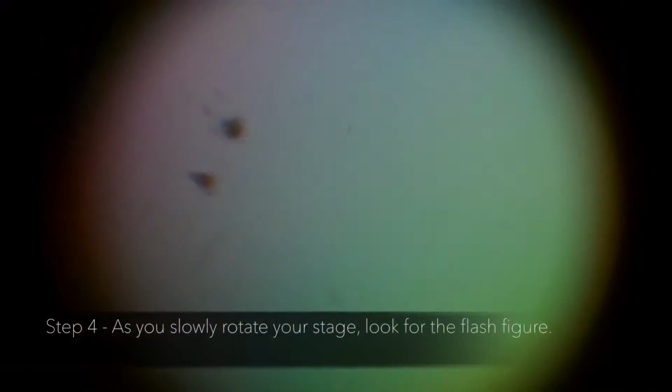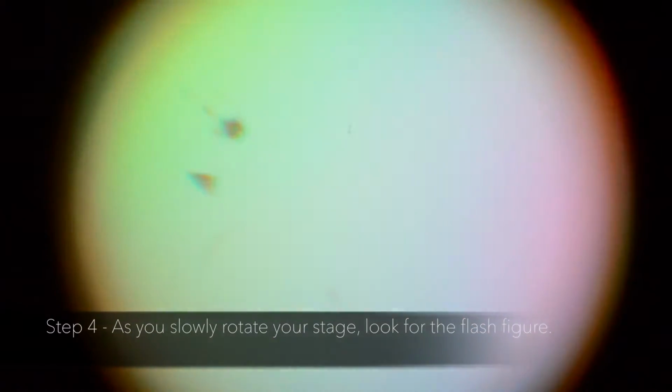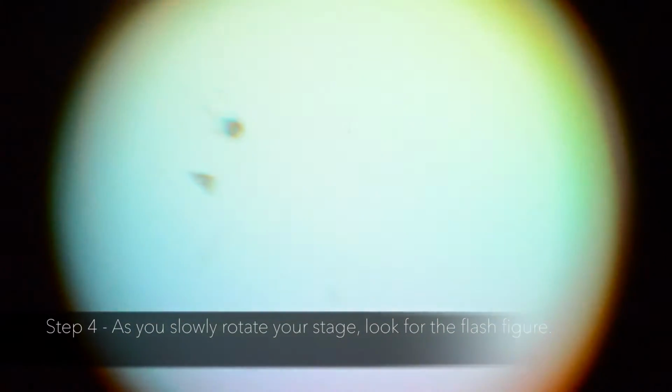Step 4. As you slowly rotate the stage, your figure should become extinct and then illuminate itself, similar to a uniaxial flash figure. Here, I am only rotating the stage by very little, only a couple of degrees. You may be able to see a faint, thick cross appear and disappear as you rotate your stage. This is unique to biaxial minerals.